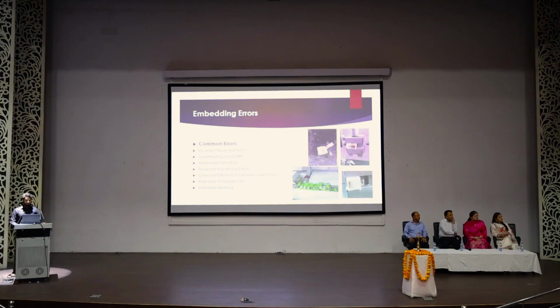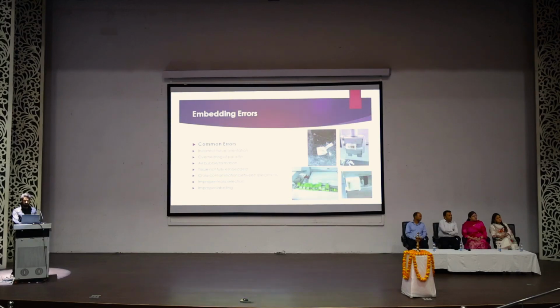The next is improper mold selection. Improper molds cause not only wastage of time and reagents, but also affect the section cutting and staining quality. The next one is improper labeling. As I said, in this image you can see multiple tissue cassettes have been opened at a time. When a technician casts the blocks at a time, by any reason he forgets which tissue from which cassette he has embedded in which mold. He may take one label from one cassette and label it to another block.